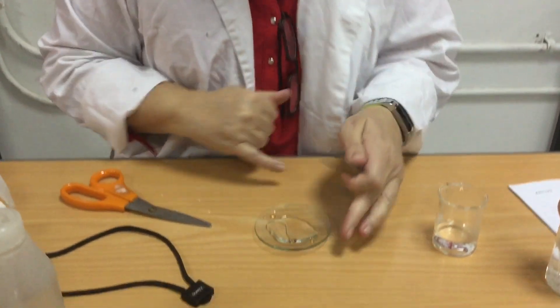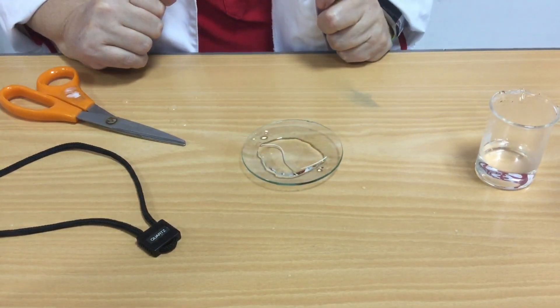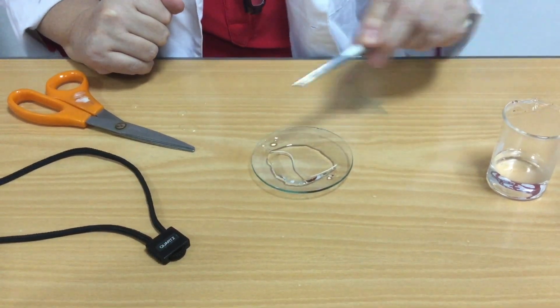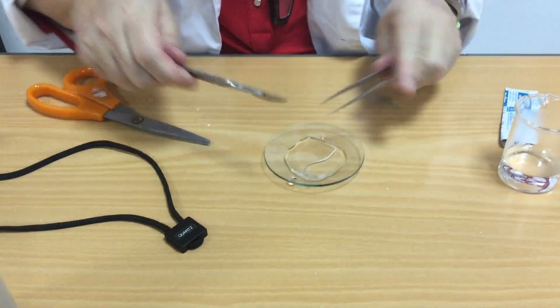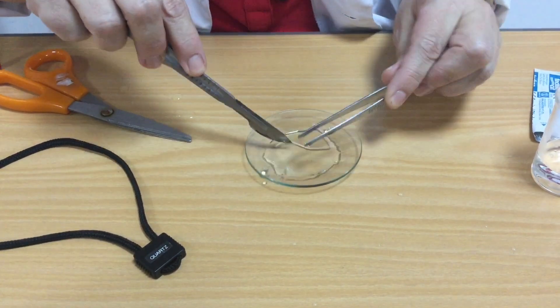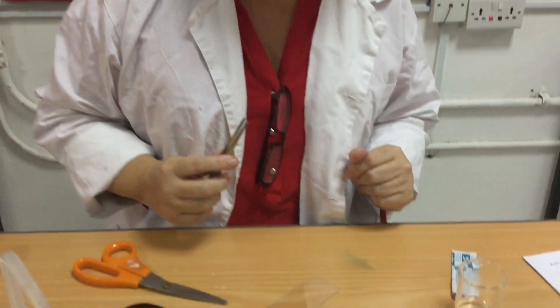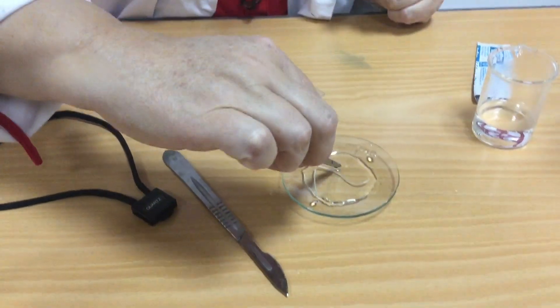What I need to do now is cut three millimetres from the end, because that's the actively dividing root tip. I need to make sure I can see which end is the root tip. I can see this one goes into a bit of an apex — goes to a point — so I know that's my root tip. So I'm going to cut that there. There's no real rush or urgency now; I can take my time because I've separated my root tip, stopped the reaction by removing the acid.